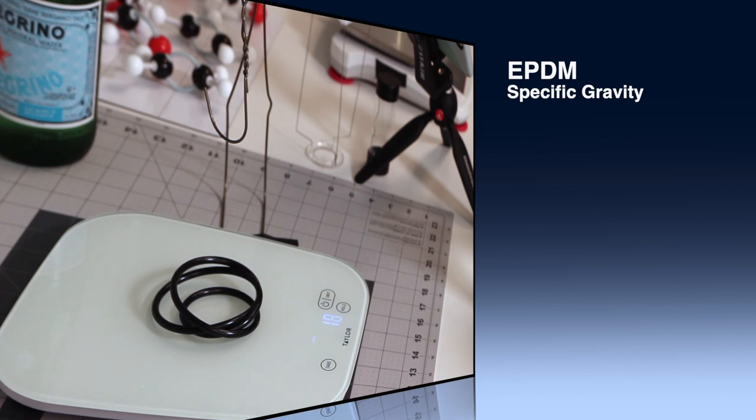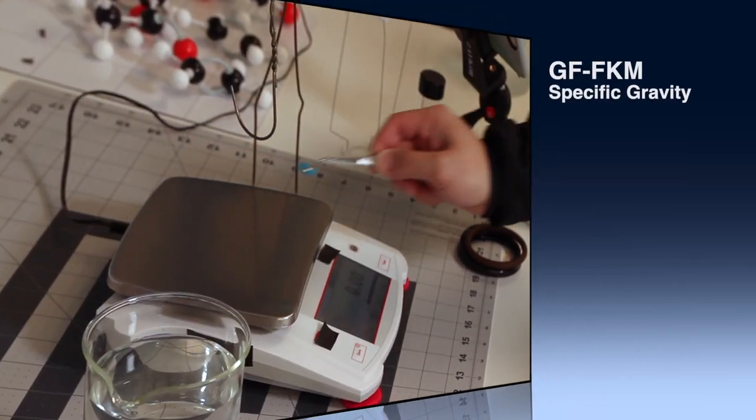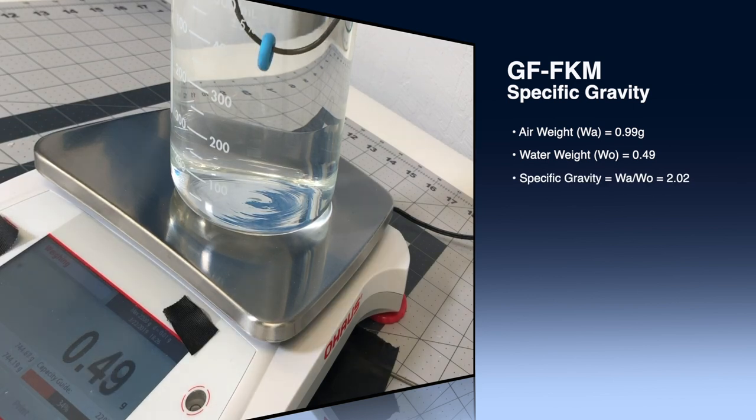We'll demo two sets of O-rings to show you the results. To be honest, both scales will do the job — it really depends on the size of the O-ring or testing specimen. Of course, all testing methods have their own pros and cons; sometimes it's just a matter of timing and cost. With any new technique, it's always a good idea to validate it. Just like the famous quotation in the photography world: the best camera is the one that's with you. The best test is the test with you all the time.